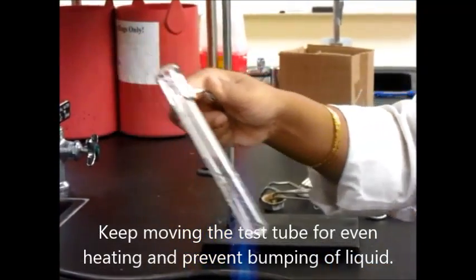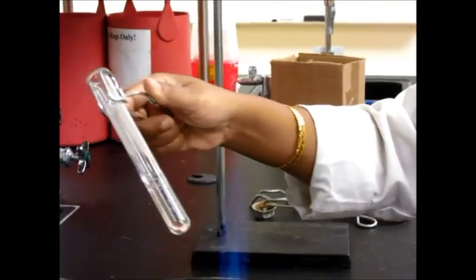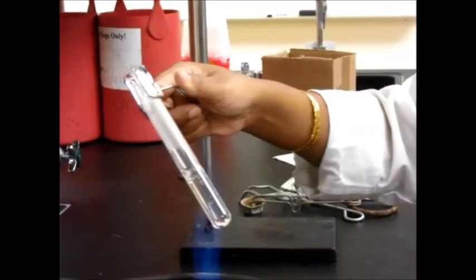It's a very fast heating, so you have to be really careful. Keep moving the test tube, and that's how you heat a test tube on a flame.